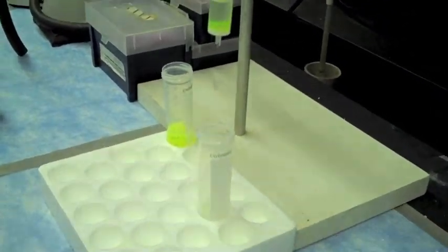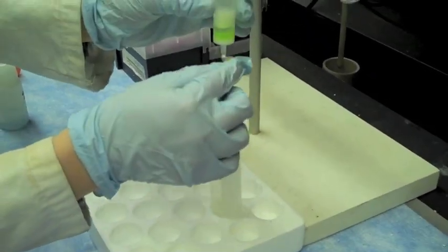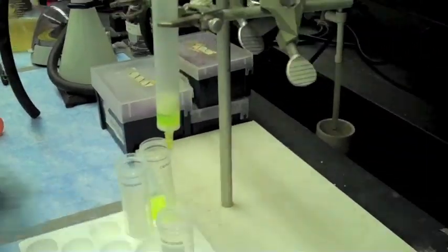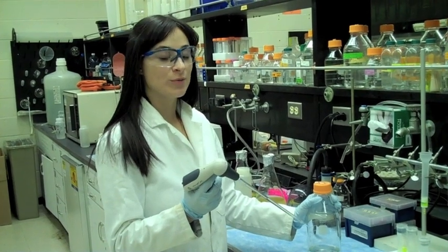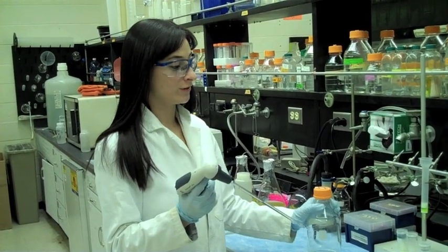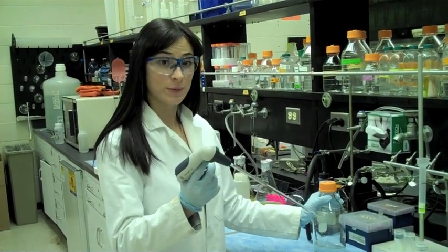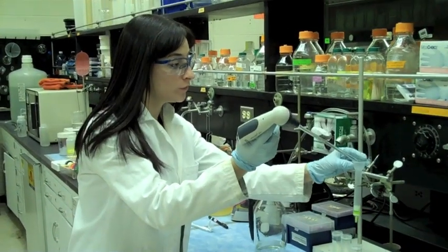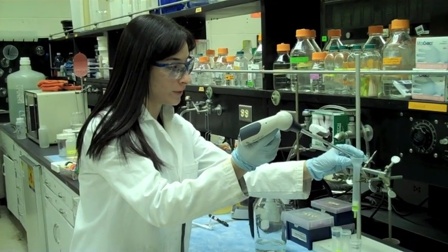At this point, we will elute the protein from the column using a solution that contains imidazole. Our third step will be to remove the green fluorescent protein from the nickel resin by adding a special solution that will remove the protein specifically from the beads.